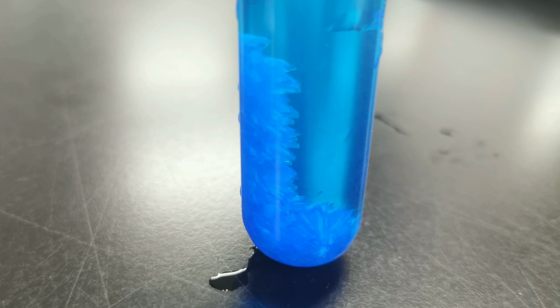Remember, it was a fairly saturated solution. So as the solution cooled down to room temperature, in this case pretty quickly because it was in the ice bath, then some of the copper 2 sulfate came out of solution and started to form a solid. So we started to grow some crystals. We can see quite a good amount of crystals, but they are fairly small. So we've got little crystals, lots of little crystals have formed throughout. Okay, so definitely formed. We knew they were going to form. It's the size that we're really looking at, and what we're looking at is small crystals here.